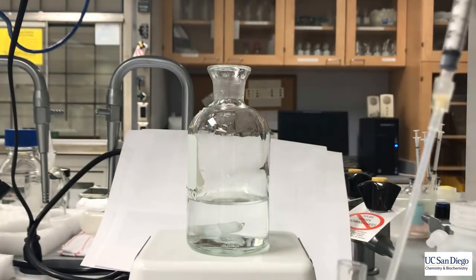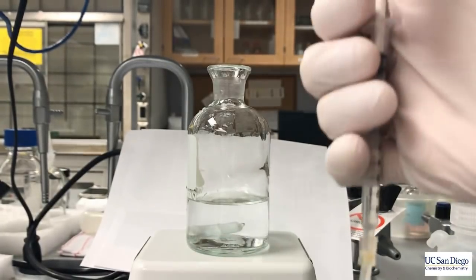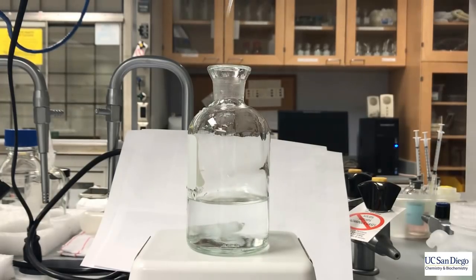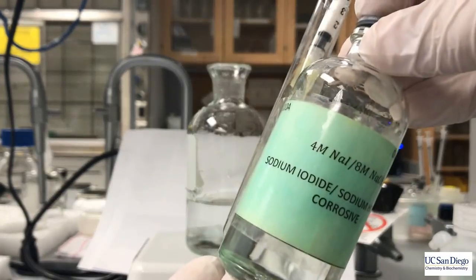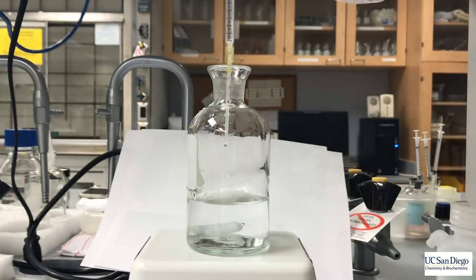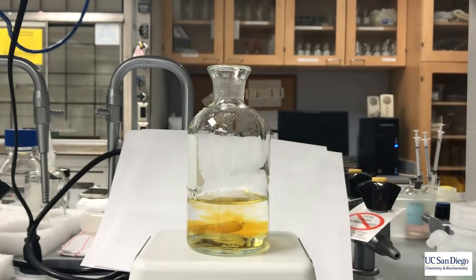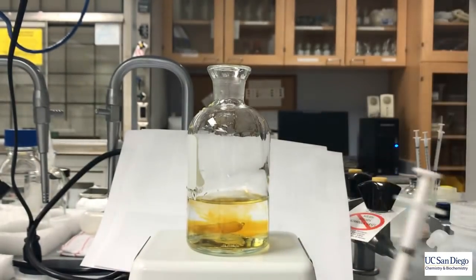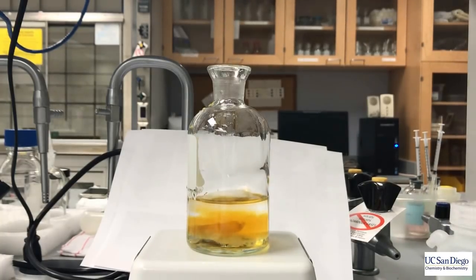Next, add the sulfuric acid. Note that this order of reagent additions will vary from our titration of the seawater. Next will come the sodium iodide and the sodium hydroxide solution. Note that with this addition, the solution does turn yellow due to the formation of iodine. Next comes the addition of manganese chloride. Note that because we have not stirred our solution, we have not equilibrated the pH and thus we have precipitated some of the manganese hydroxide.